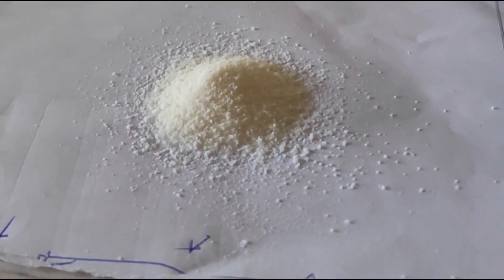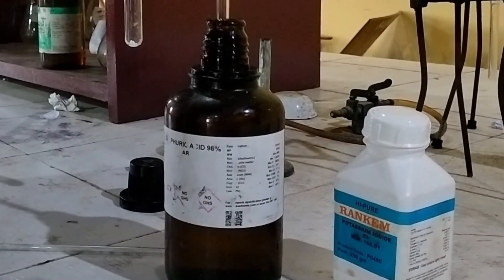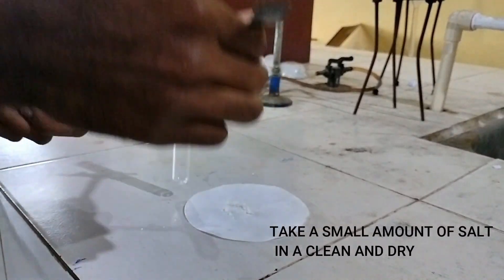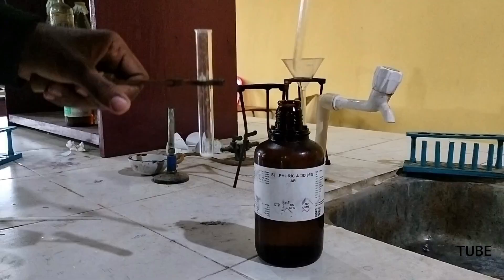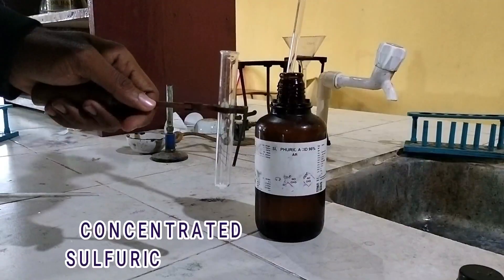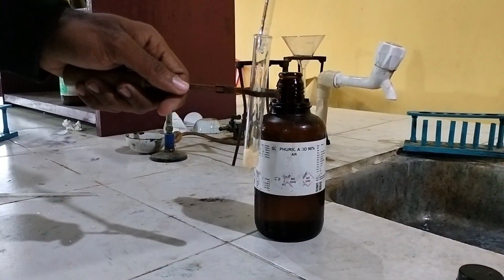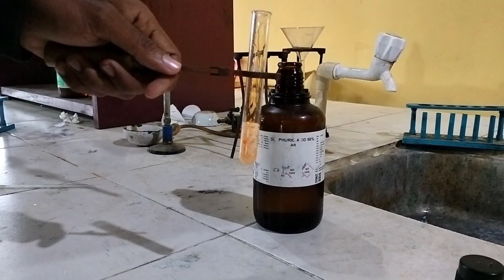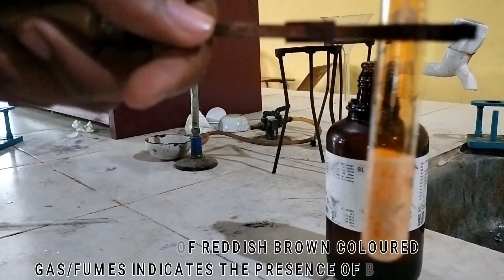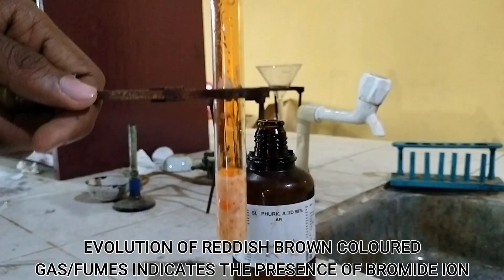Add a small amount of salt in a clean and dry test tube and add concentrated sulfuric acid. Evolution of reddish brown fumes indicates the presence of bromide.